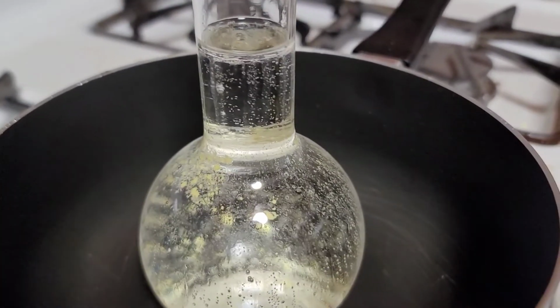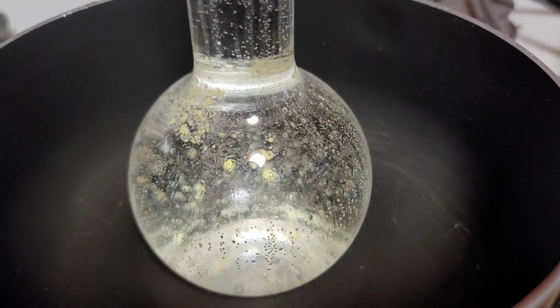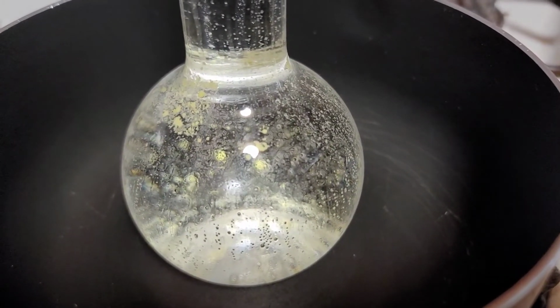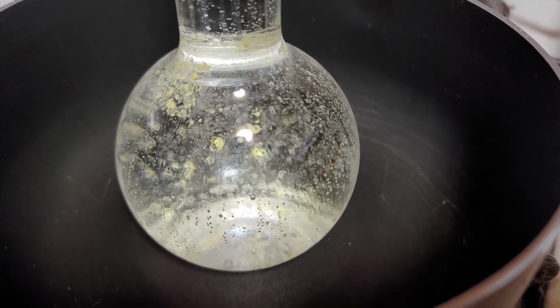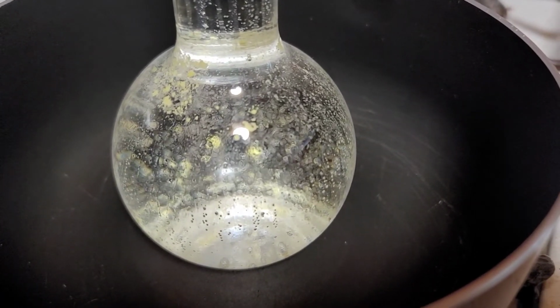Putting distilled water inside and heating it up. Breaking that stuff loose from the sides. Gradually. I can see that it is working.